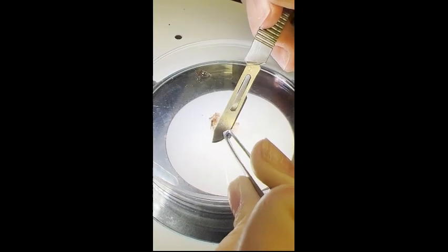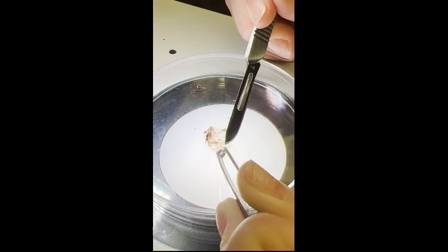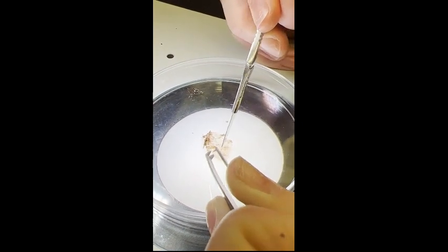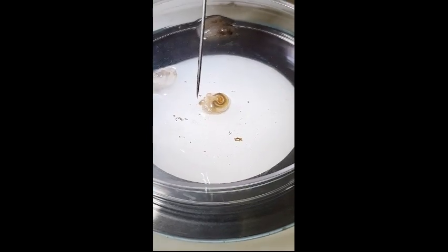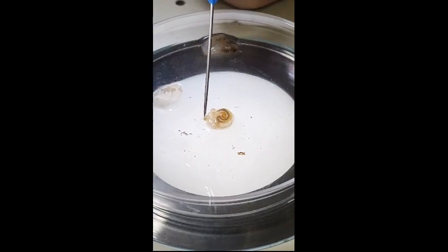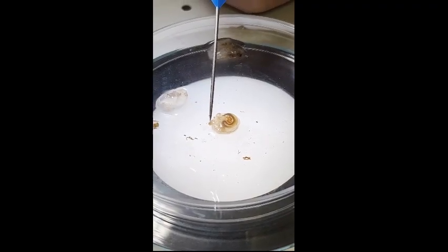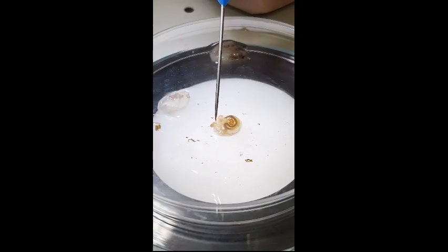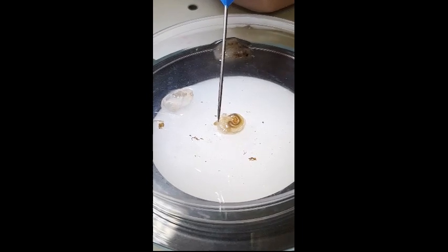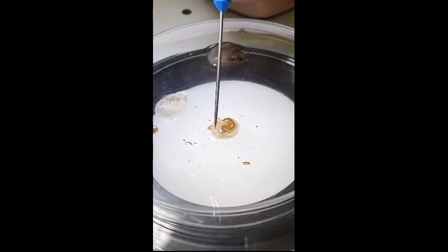Now we will be dissecting an adult sea squirt. First, we remove the tunic. This protects the skin so we can clearly see the internal anatomy. First, the incurrent siphon, or the mouth, is here and it intakes food. That then leads into the pharynx, where pharyngeal slits are apparent. Along one side of the pharynx lies the ribbon-like endostyle.